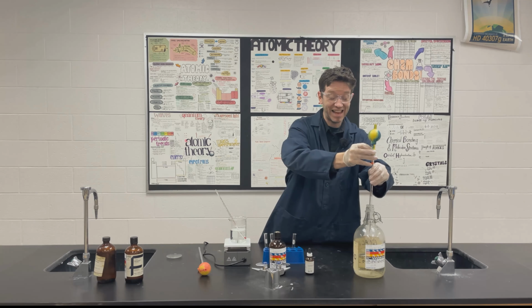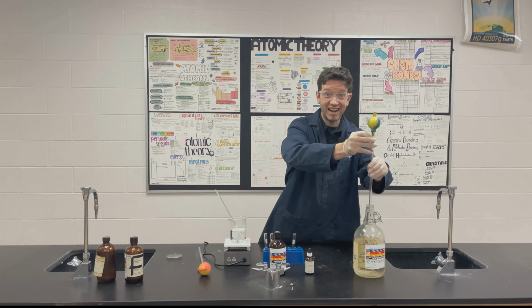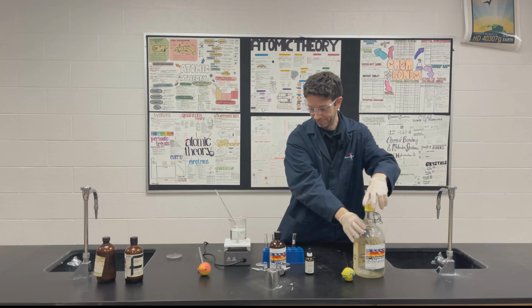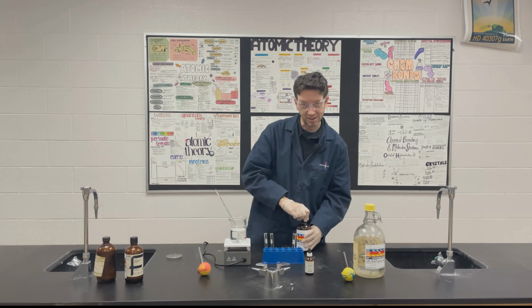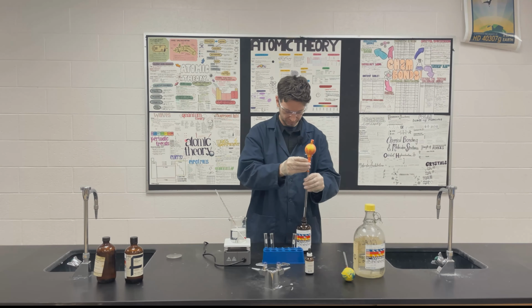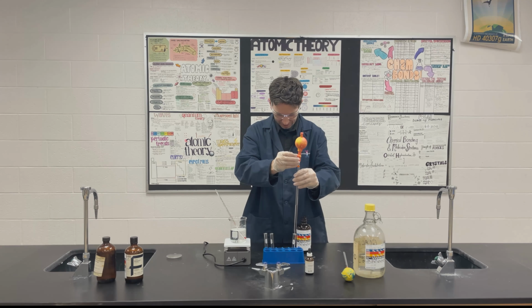It in itself has a very strong vinegar smell because it is highly concentrated vinegar. You do not want this on your French fries. So once that's in there, I am closing this up. Then we're going to take 1 milliliter of our alcohol and put it in that same test tube.